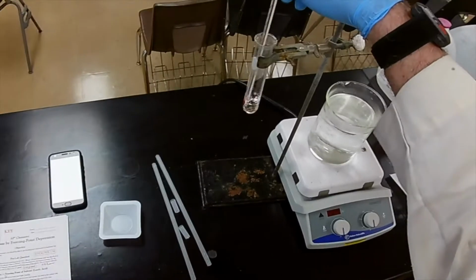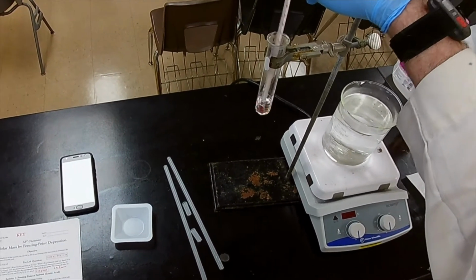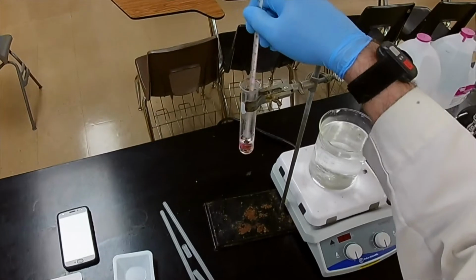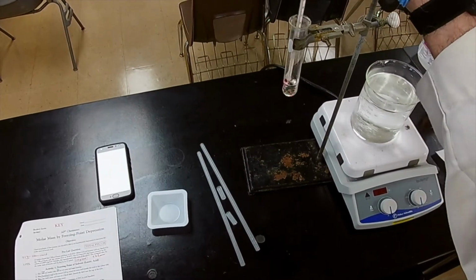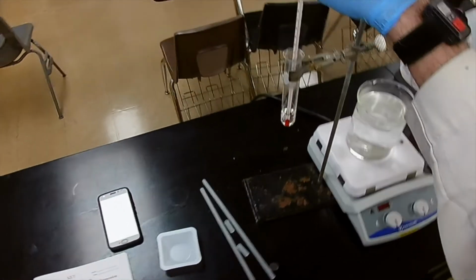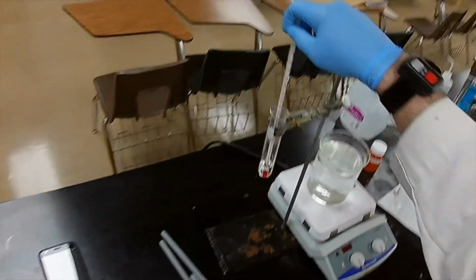That's the objective of this experiment. And then once we get that value, we can compare it to the accepted value for benzoic acid and see how close you are to it. We can actually quantify how close you are to it. Percent error. You should remember how to do that because we did that in our lab techniques exercise. All right.